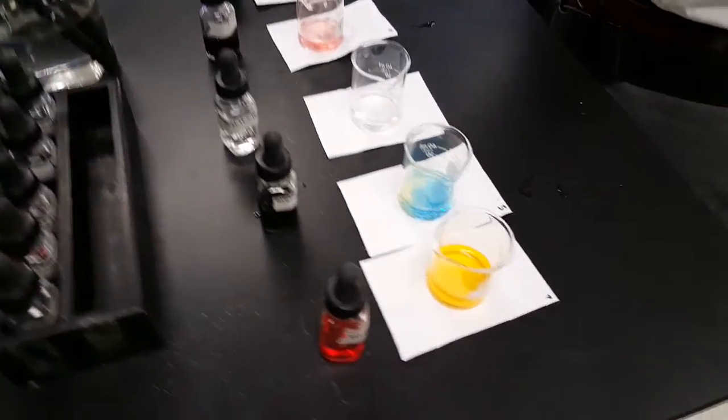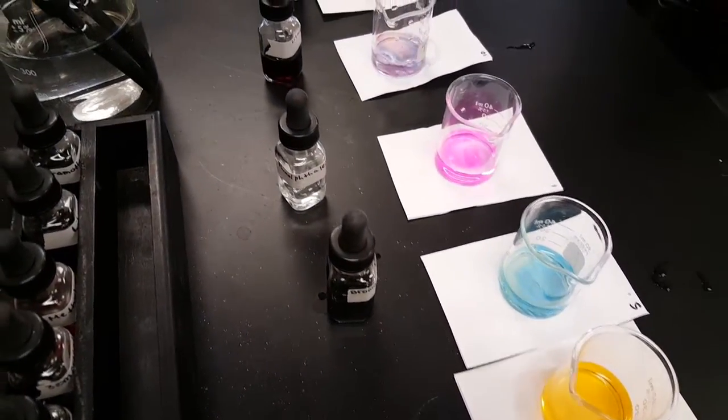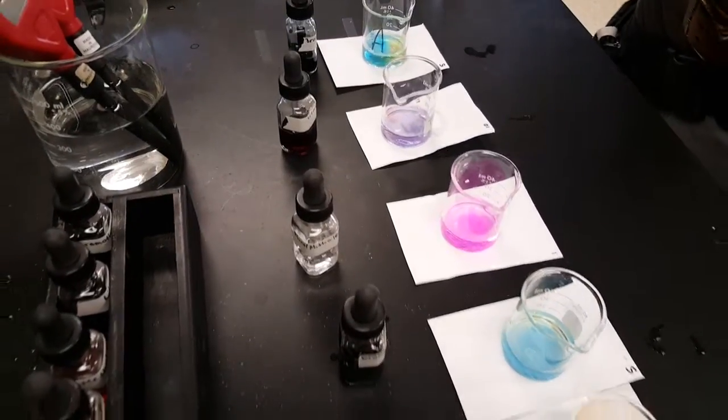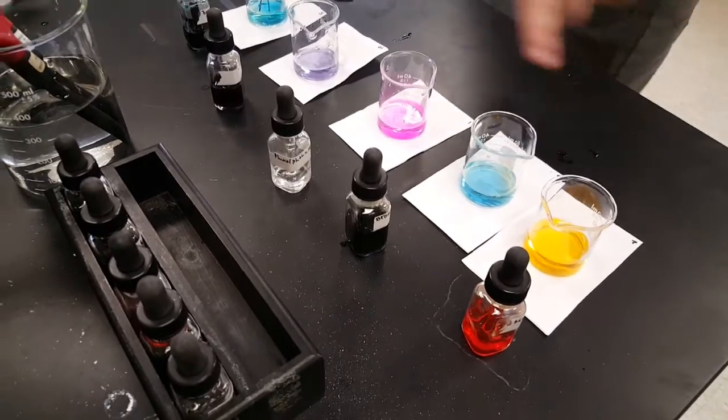What am I doing wrong right now? You're throwing so much in that you're not even paying attention. Because I don't want you all to get answers just by watching this video. I want you to actually do it. Notice there's color changes happening.